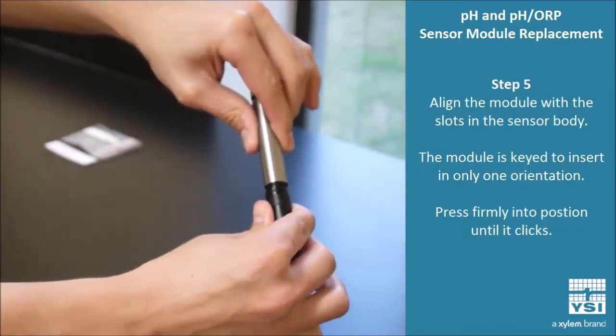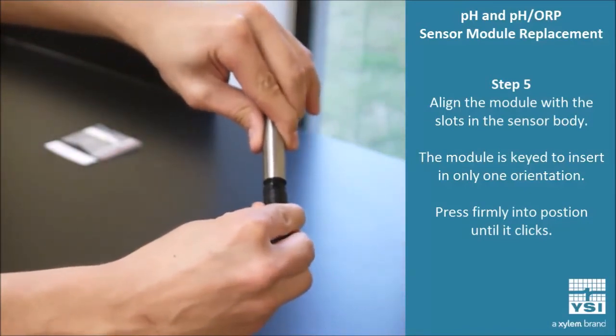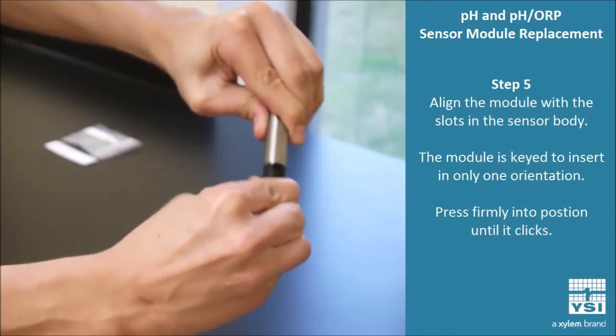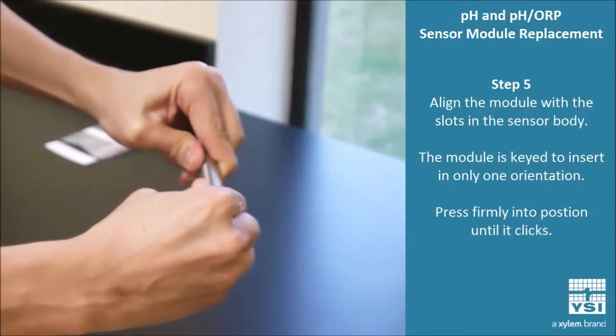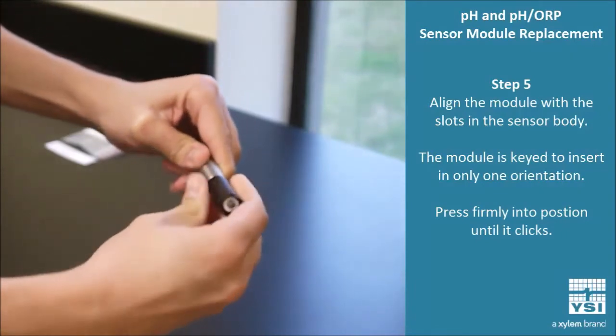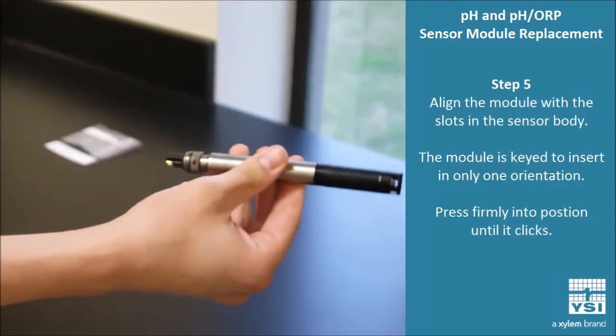You can just feel in there to make sure that you're lined up. Finally, just plug it in. Make sure you hear a click. And then you have it installed.